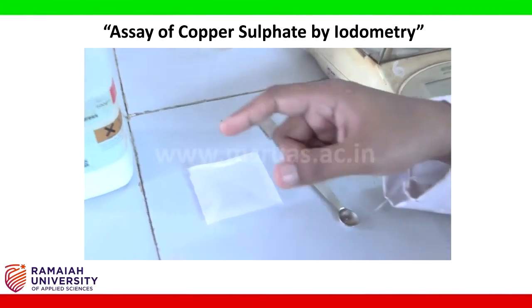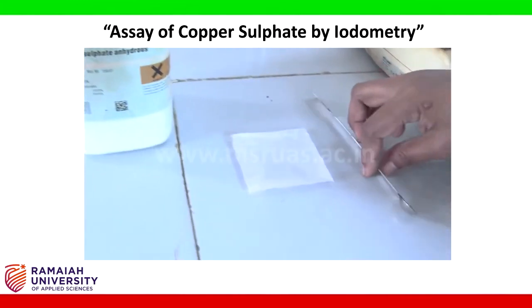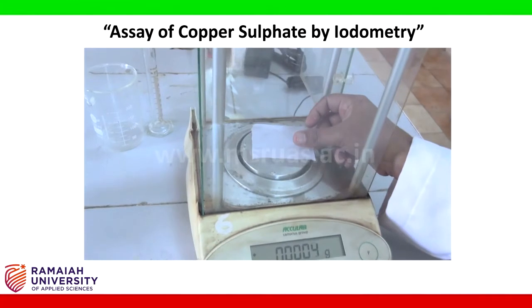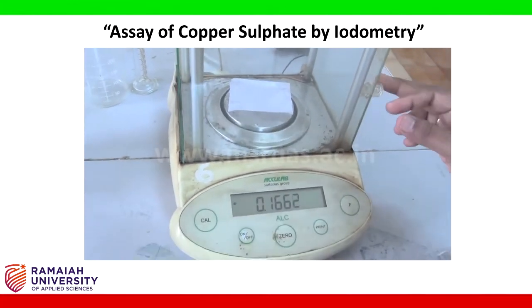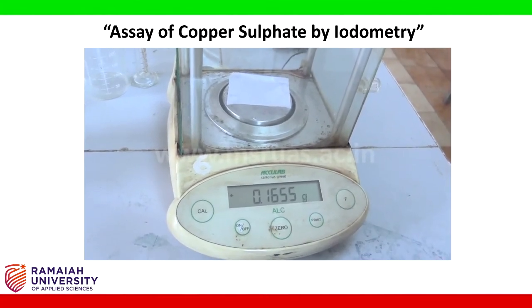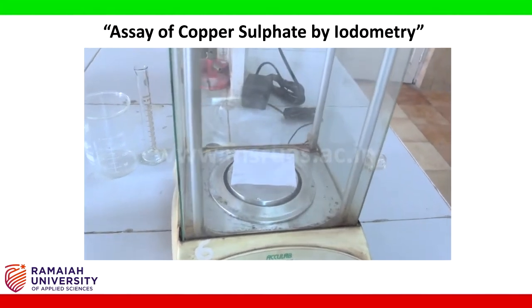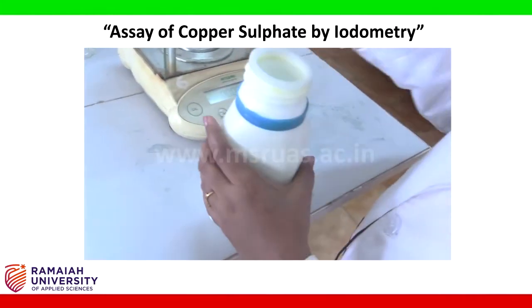Weigh 1 gram of copper sulphate using butter paper. Tare the paper weight to 0. Then add 1 gram of copper sulphate.